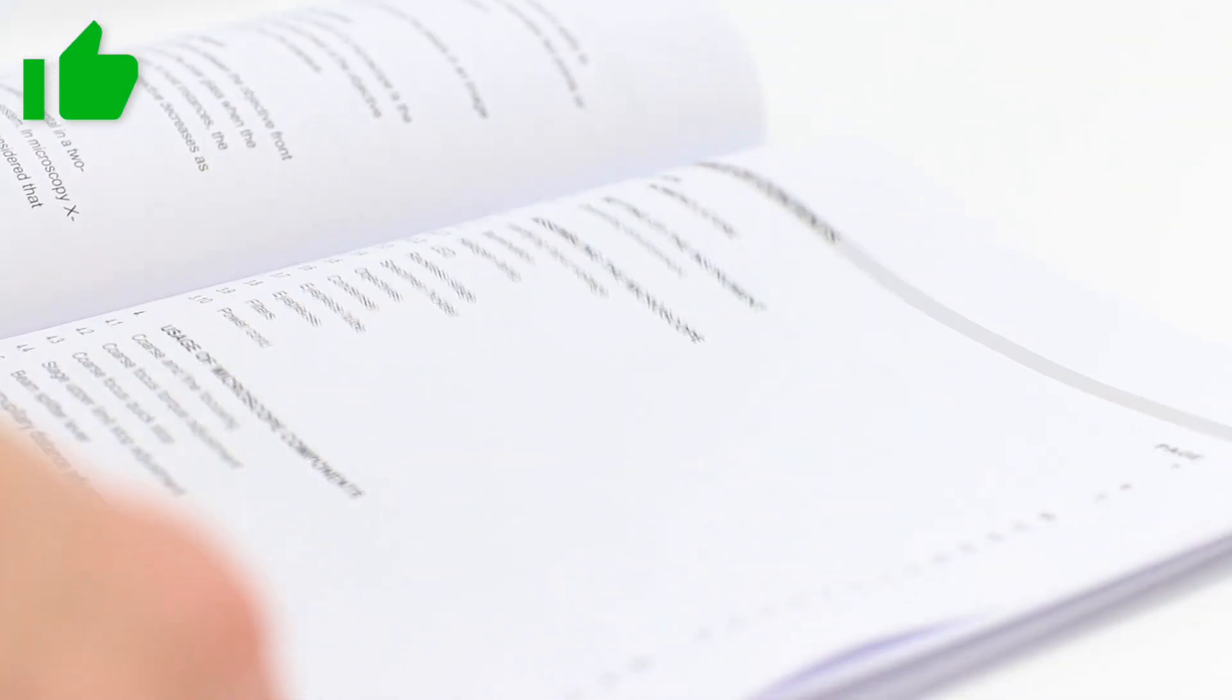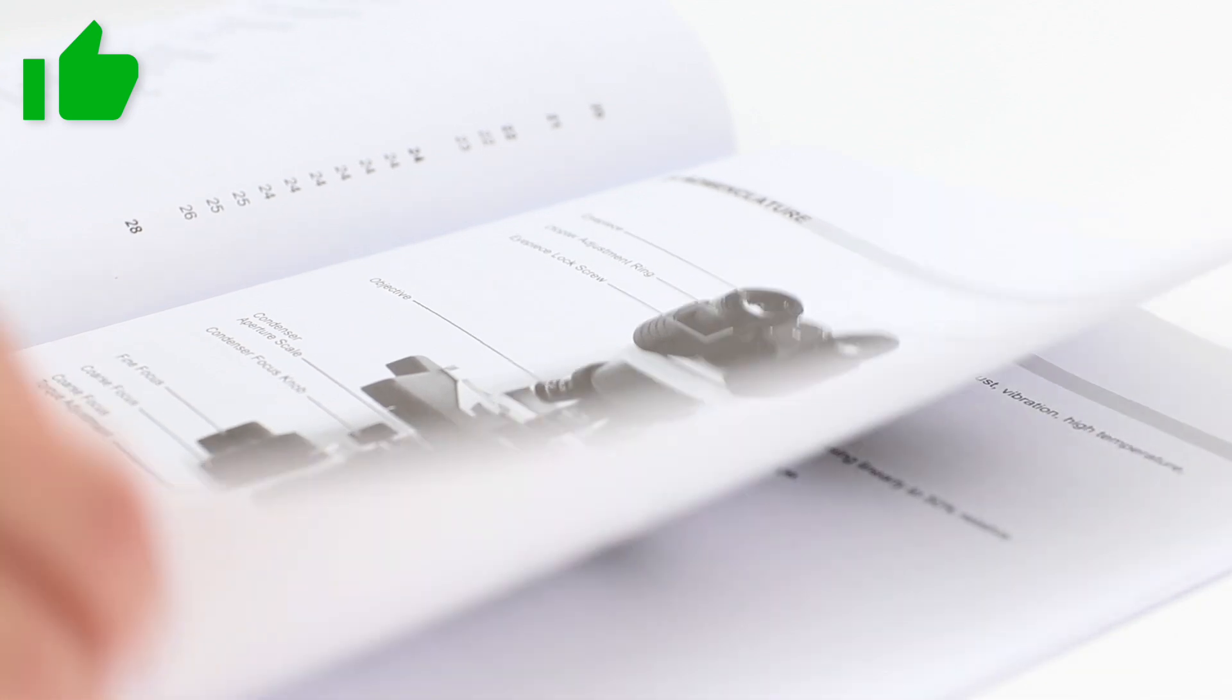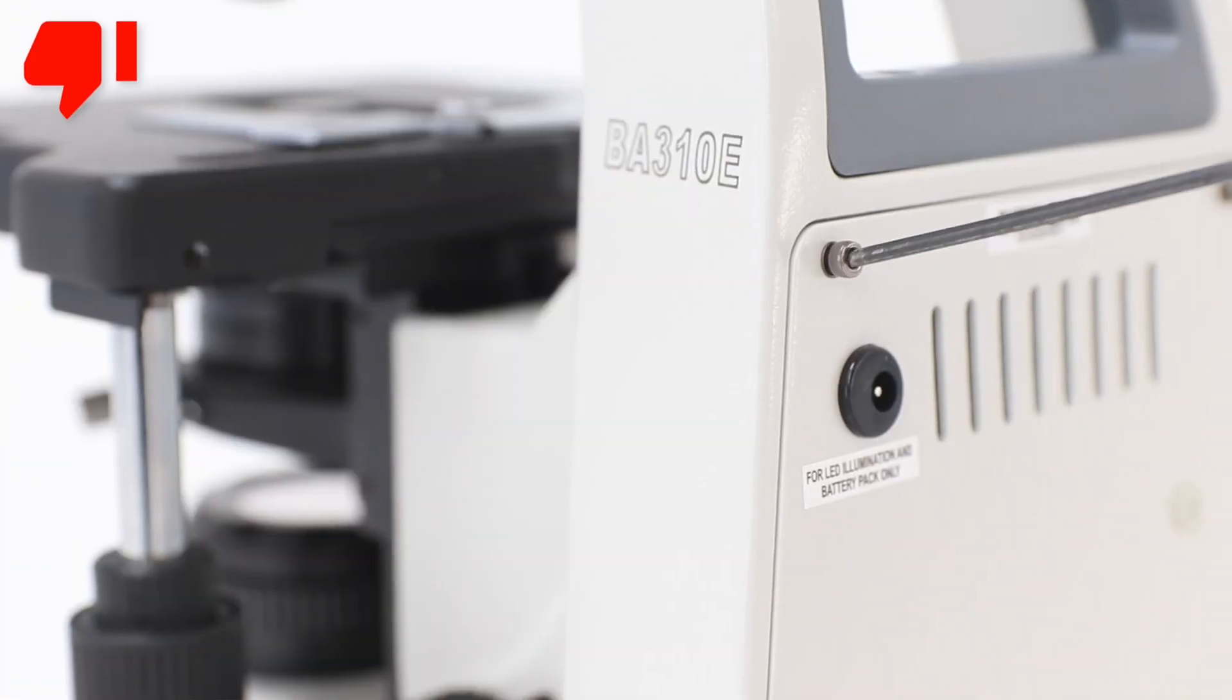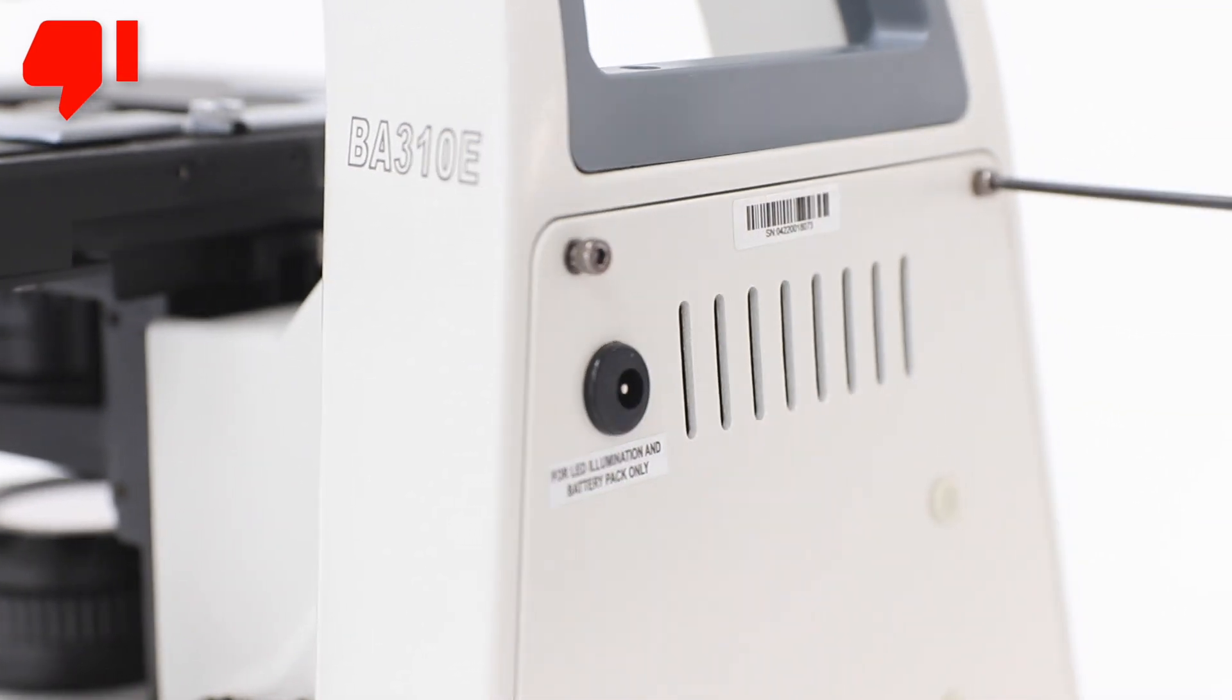Before using the microscope, make sure you carefully read the instruction manual of your device. Never attempt to disassemble the parts of the instrument unless pointed out in the manual.